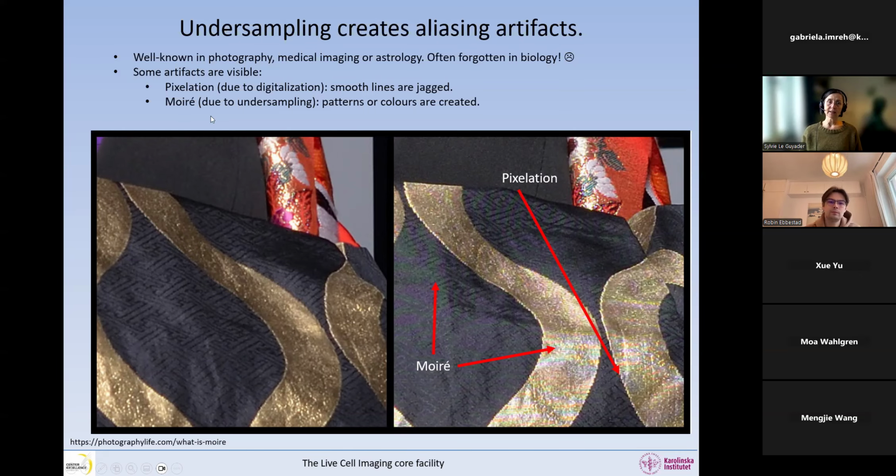And then we get moire as well. Moire, as you can see in here, is due to undersampling. So moire is a pattern or a color that is created in the image and that does not normally exist. So this one is sampled properly, has no moire patterns, but it anyway has pixelation because we basically have discrete points. But the moire patterns disappear when you do not undersample, when you sample properly.